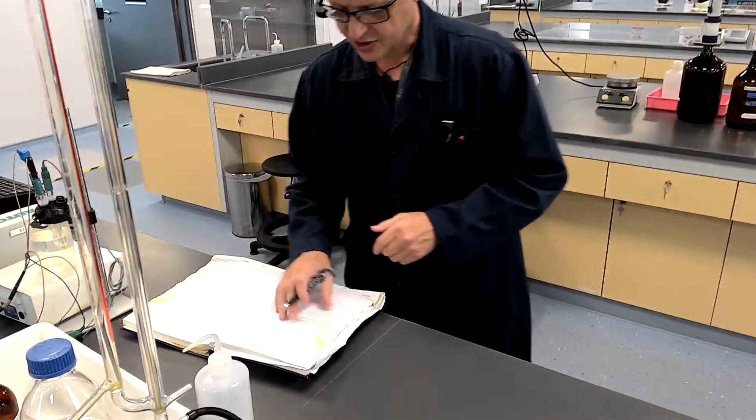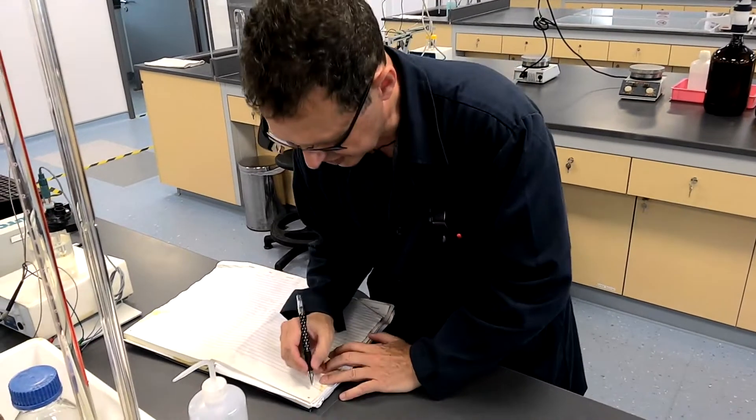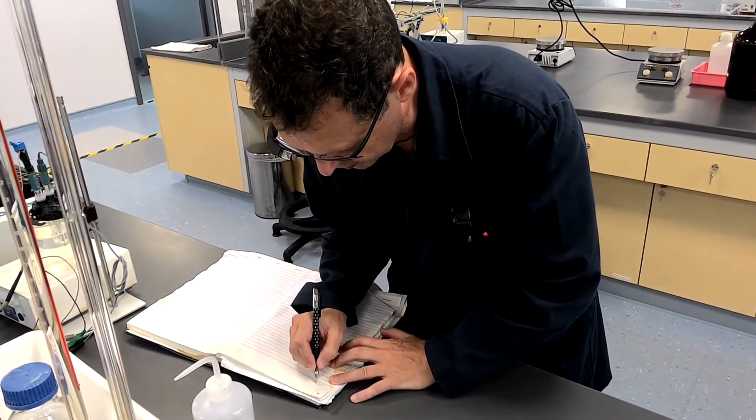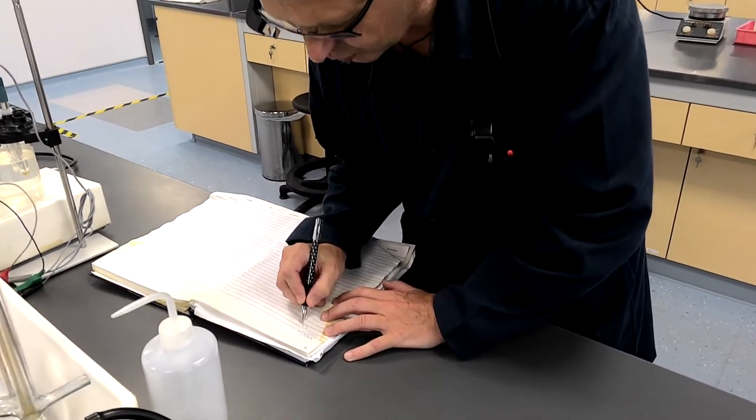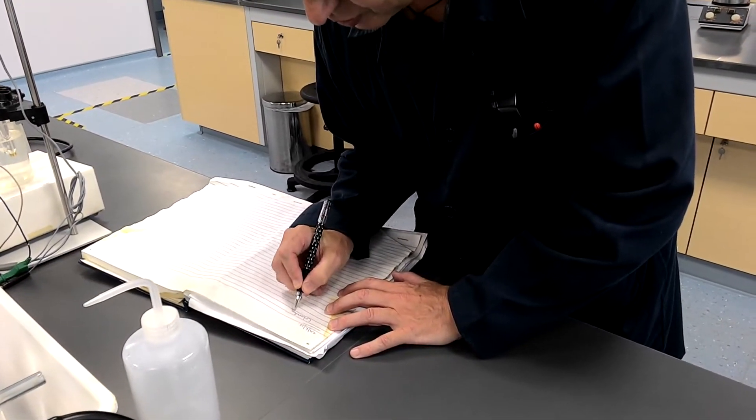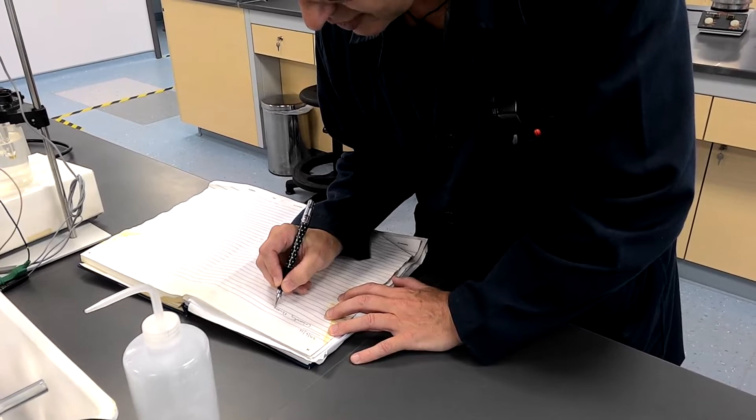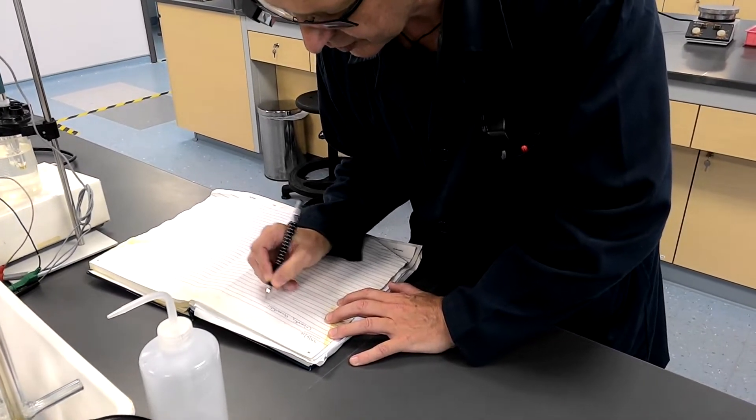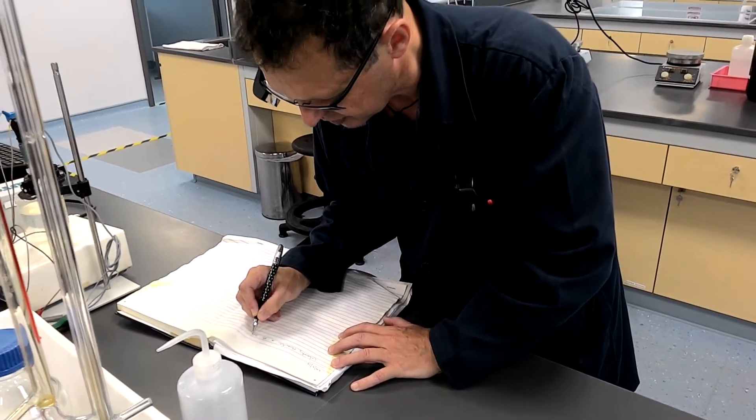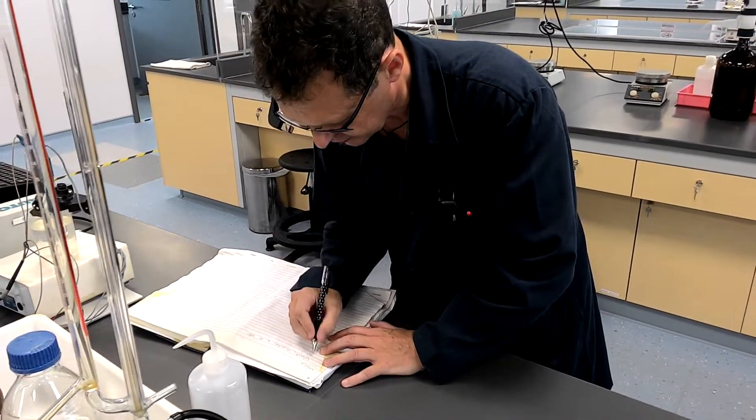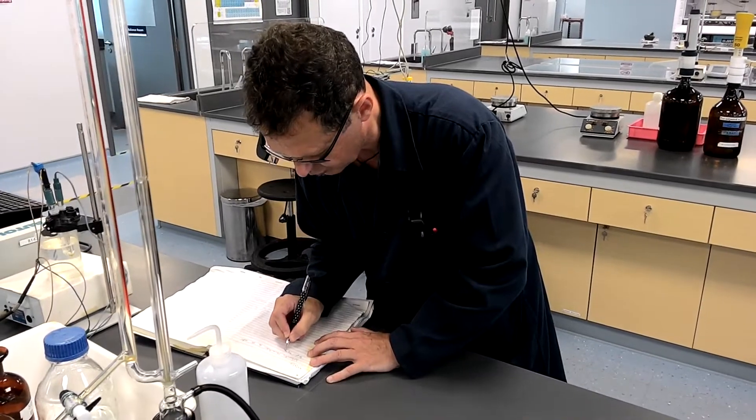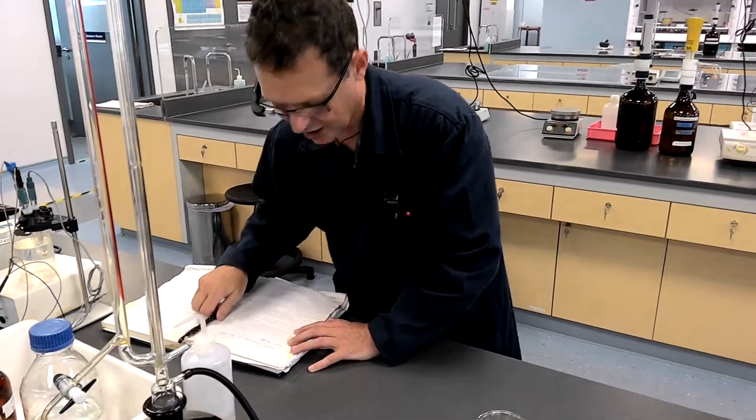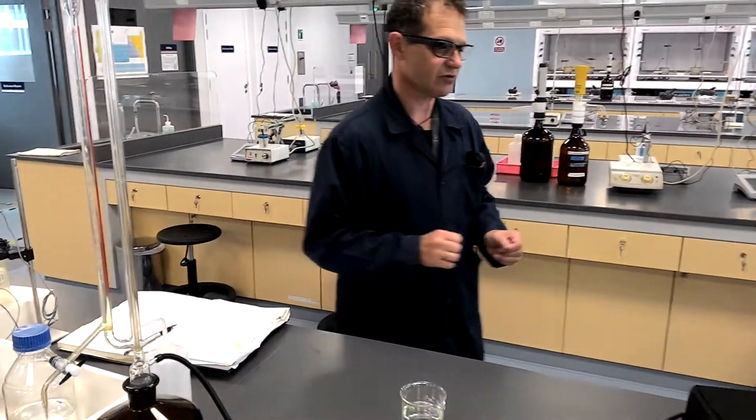Okay, so the date today is the 29th of June, and what I'm here for is a laboratory demonstration of dissolved oxygen water. And the sample I'll use is tap water. I'm not going to record anything else because we don't really need to.